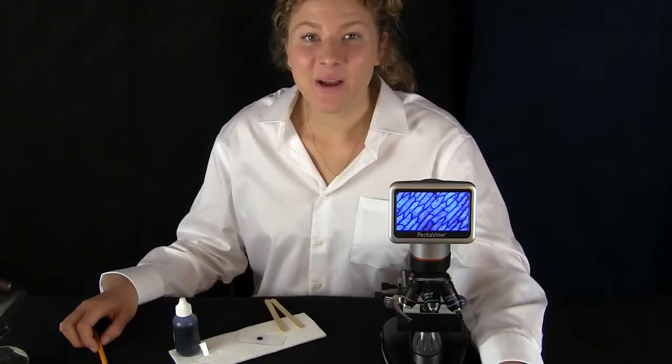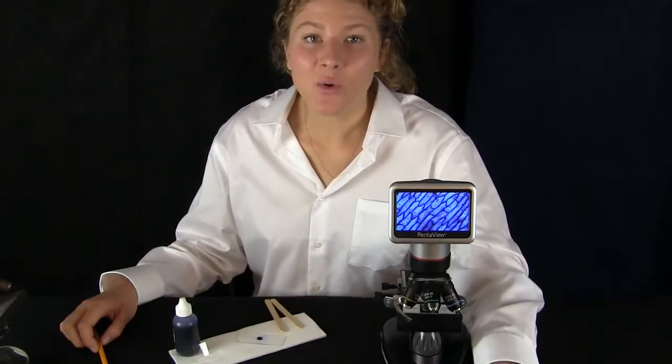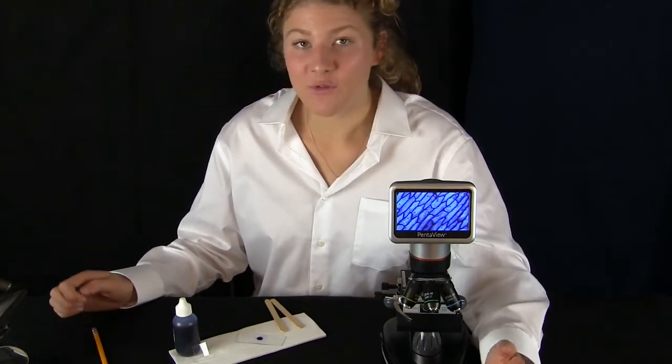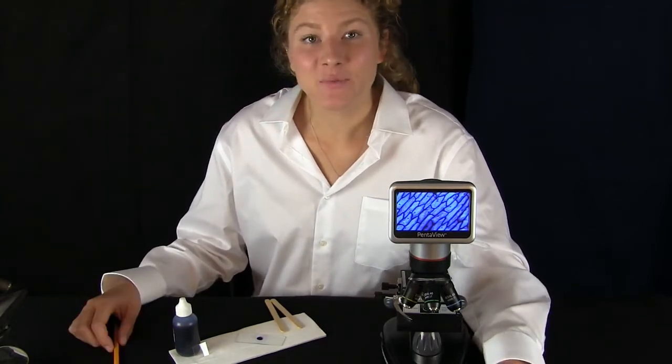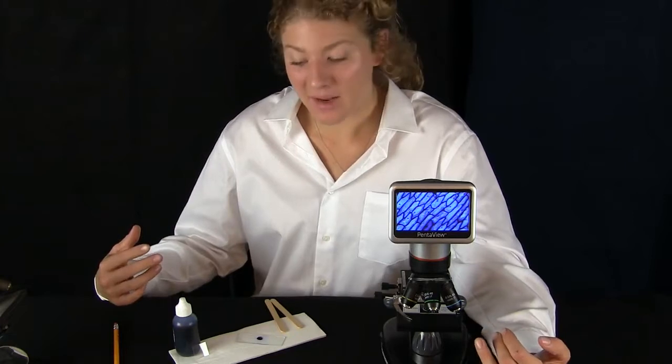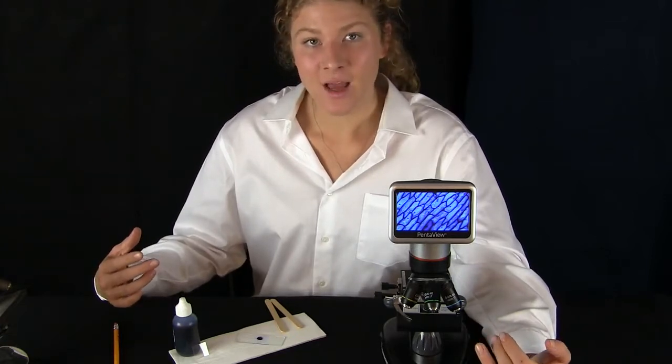They're so dark because the cell wall and the cell membrane are together protecting the cell. Cell walls are important to plants because it helps plants to stand up without bone cells. This microscope is so cool that I want to take a look at some of my cells, because remember, all living things — including me — are made of cells.